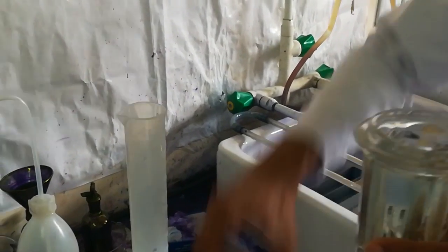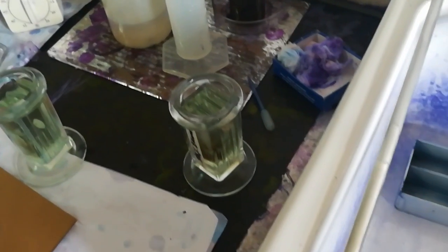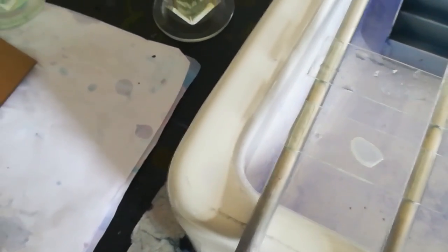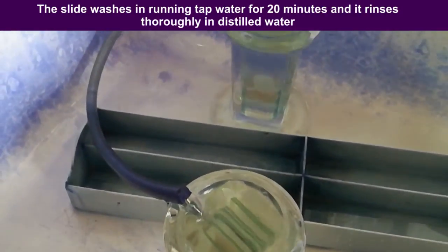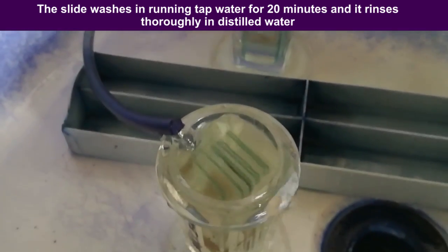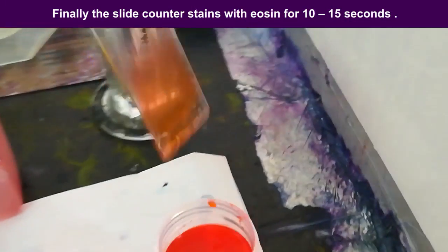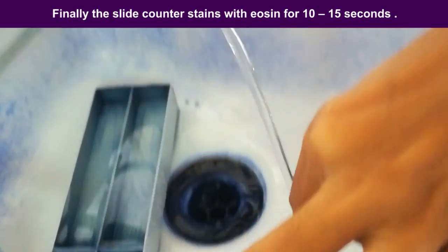When the slide is dry, it is placed in the freshly prepared solution and left for 10 minutes at about 20°C. It is then rinsed thoroughly in distilled water. Finally, the slide is counterstained using eosin for 10 to 15 seconds.